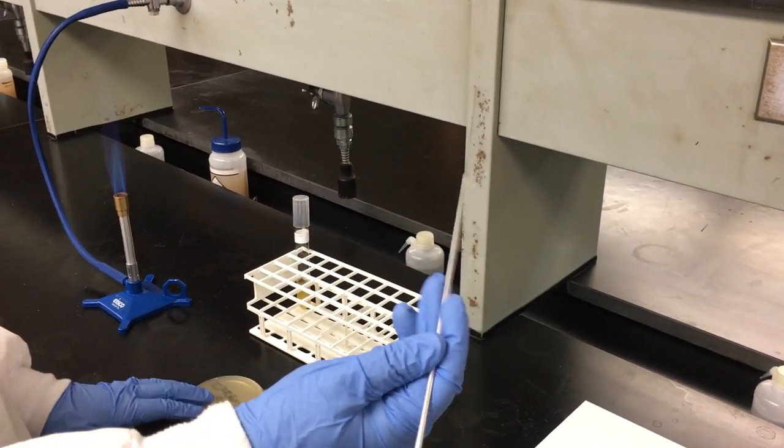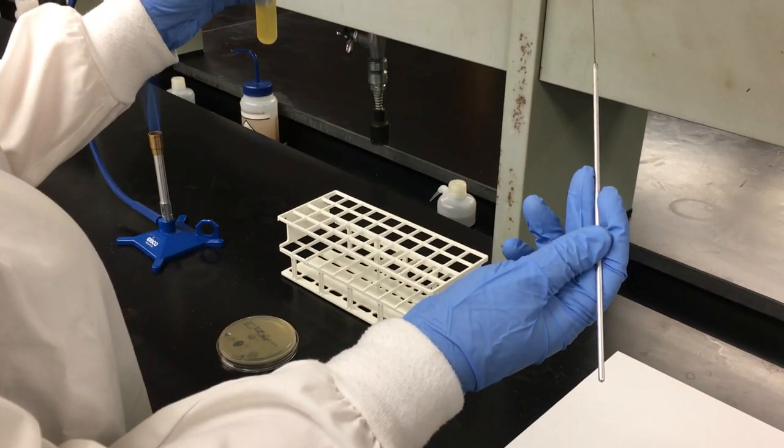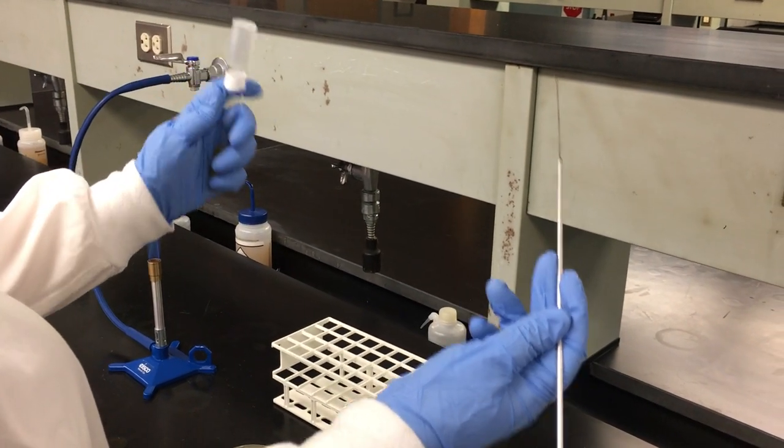We will use a loop because we're using a broth. I have a TSB broth that has already been inoculated with organism.